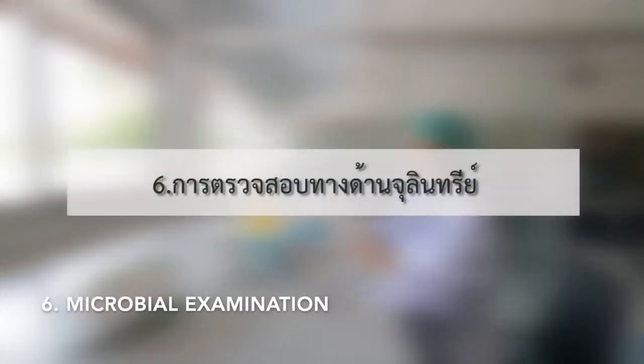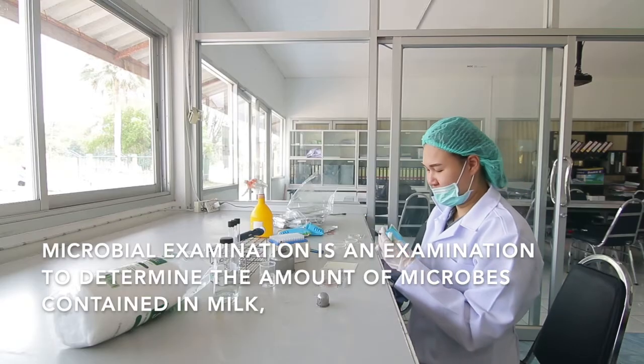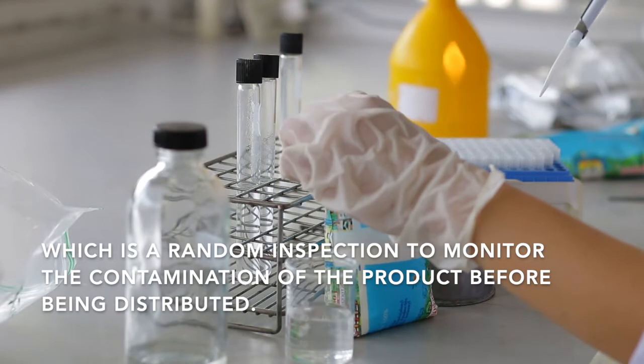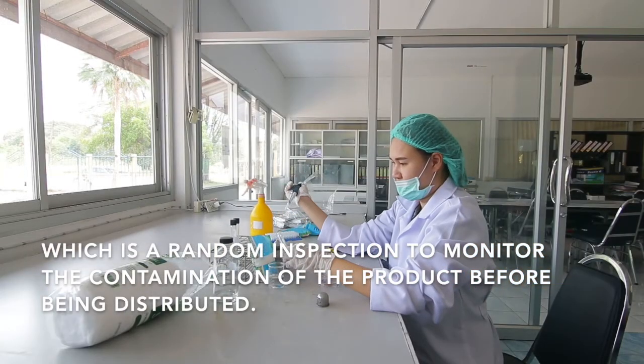Sixth, microbe examination. Microbe examination is an examination to determine the amount of microbes contained in milk, which is a random inspection to monitor the contamination of product before being distributed.